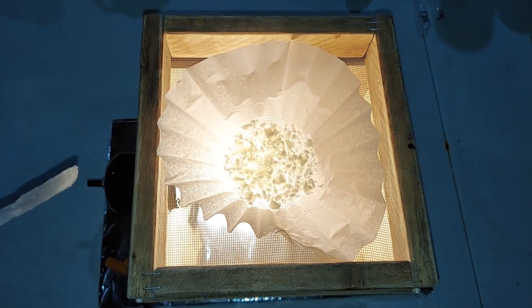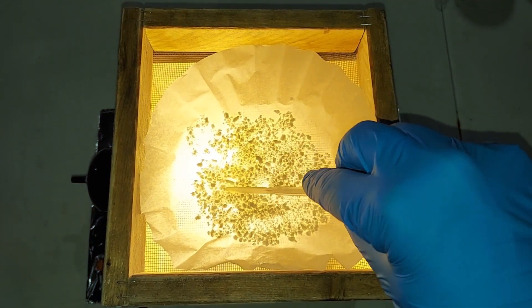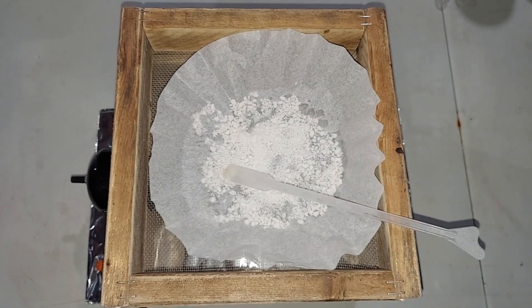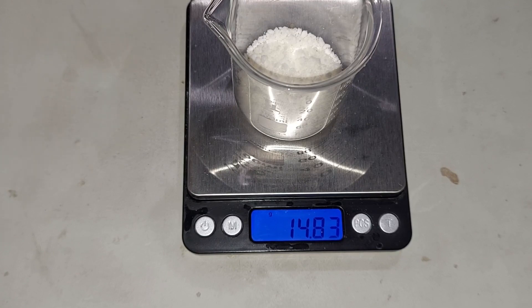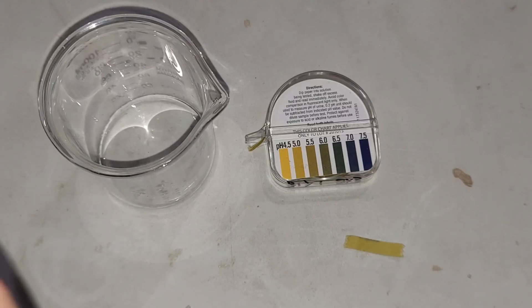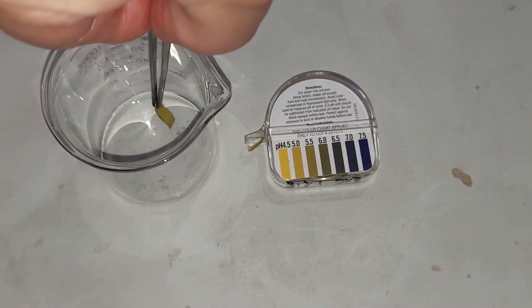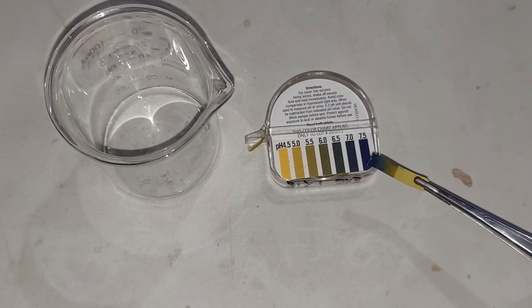I'm drying it on top of this light bulb heater here — it usually takes about half an hour to 45 minutes to dry completely, then I'll weigh it. These little balls all seem pretty crunchy so I'm 99% sure it's dry. I'm going to grind this into a powder and weigh it. Our final yield of potassium carbonate is 14.83 grams — a little lower than I expected by about 4 grams. However, I do think this product is quite pure, and that makes up for a lot. As potassium carbonate is a strong base, I'm going to place a couple of crystals on pH paper — you can clearly see it is very dark, confirming it is a strong base, which is exactly what we'd expect.